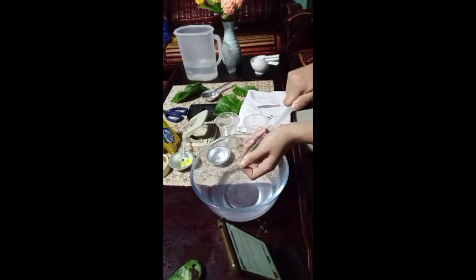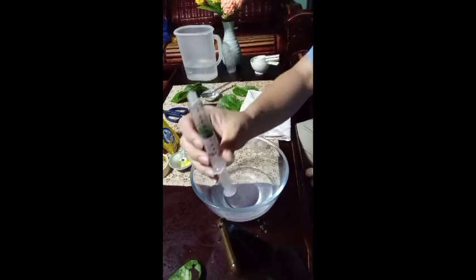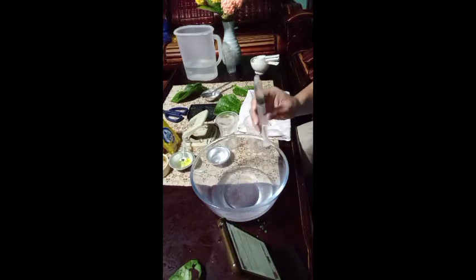Use your finger to close the opening of the syringe and pull back on the plunger to create a vacuum. Hold the vacuum for 10 to 15 seconds while shaking the syringe slightly. The vacuum removes all the air from the air pockets within the alugbati leaf discs. Release the plunger and remove your finger from the syringe opening to release the vacuum. The leaf discs should now sink to the bottom. If necessary, repeat the vacuum procedure until all the leaf discs sink.